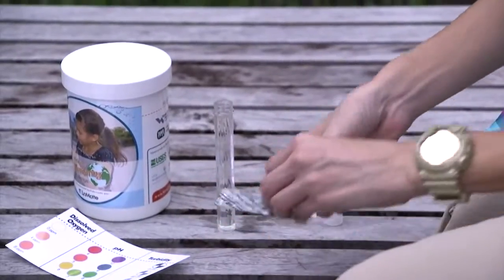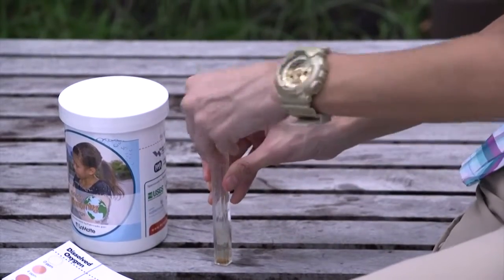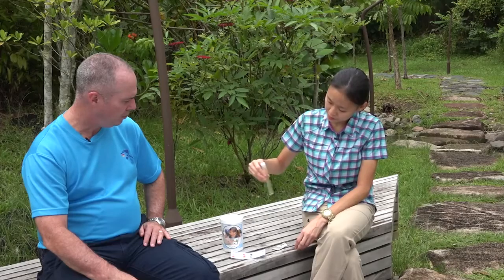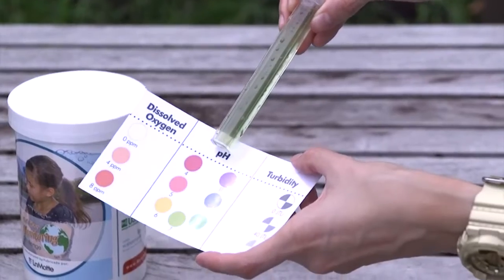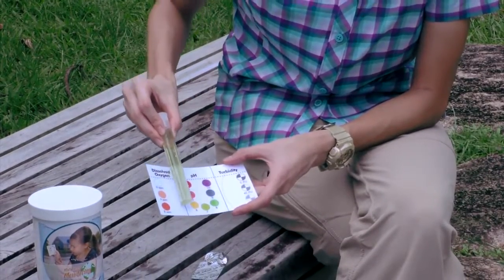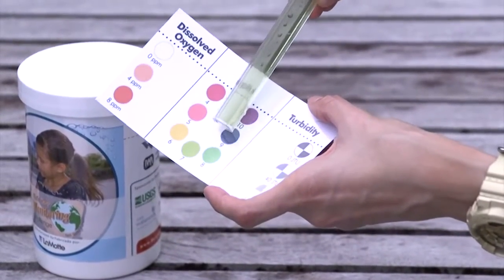We then drop 1 pH tablet into the test tube, cap it, and mix the tablet well by inverting it or gently shaking it. Allow the colour to fully develop. We can then compare the colour of the sample to the pH colour chart. It is okay to estimate the values if the colour of the sample falls in between the colour chart values. In this case, we can say that the pH of this sample is about 7.